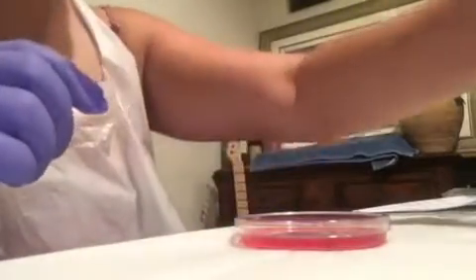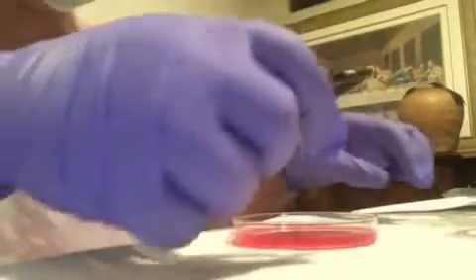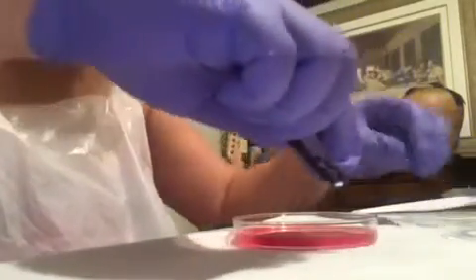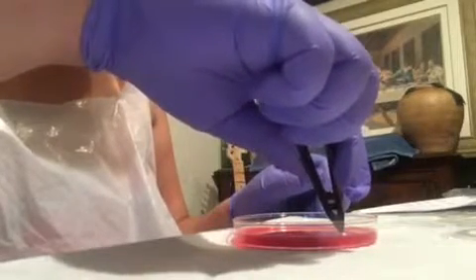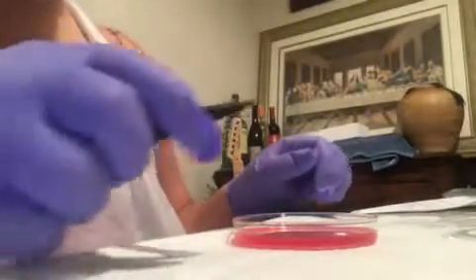Okay, it's been one to two hours, so let's get started again. Now we're going to place the antibiotic disc onto the assigned area. Just placing it in the center. Now we're going to do the rest for the other ones as well.